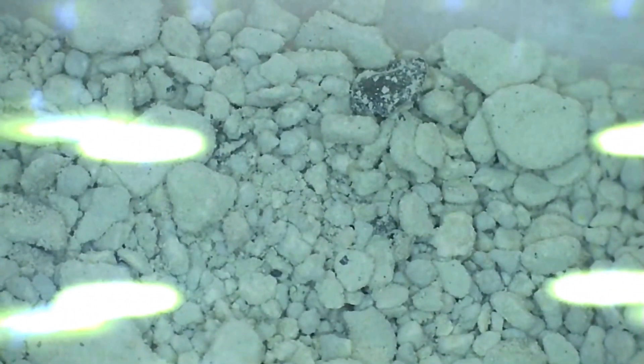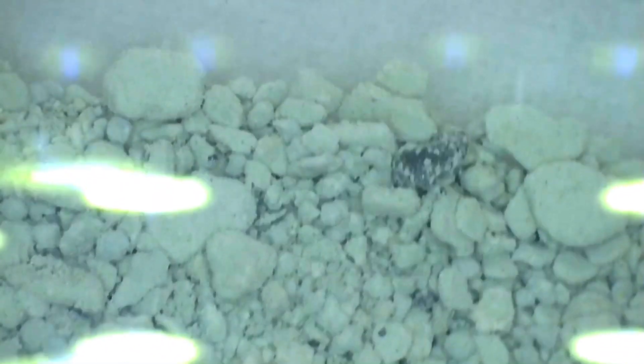And there you go. The black stuff is what we desired which is metal and the grey stuff is leftover oxide. The black spots are good enough for an element collection but the entire ampoule, well you can't use it for any experiments because it's more oxide impurity than actual product.